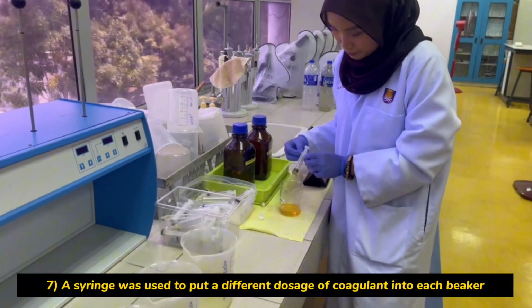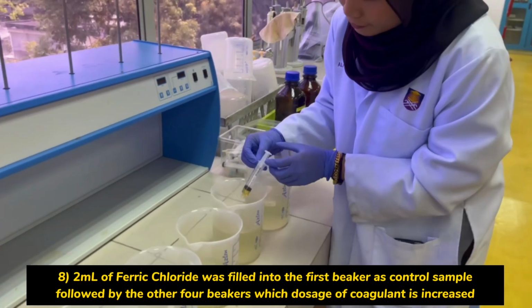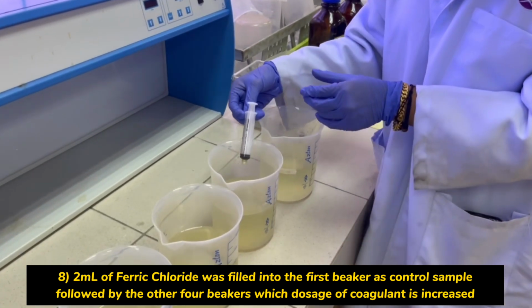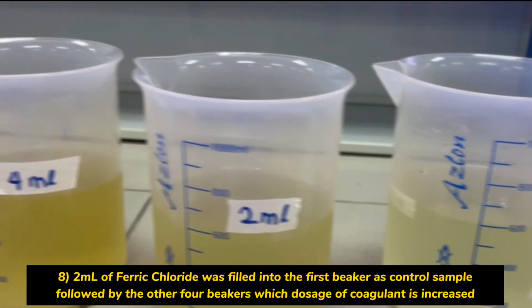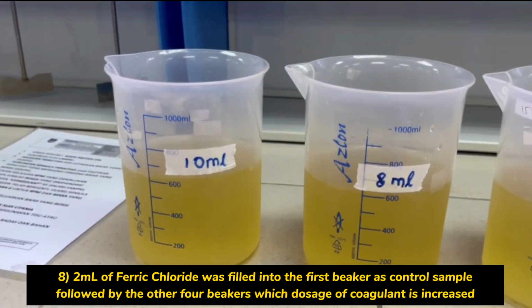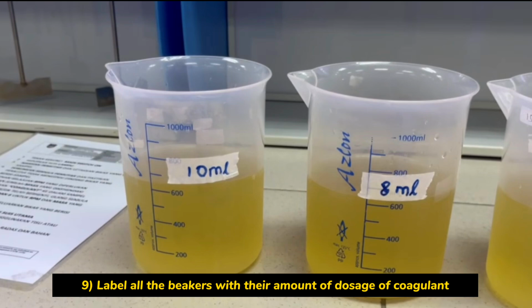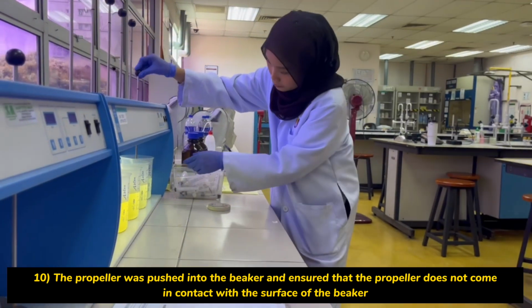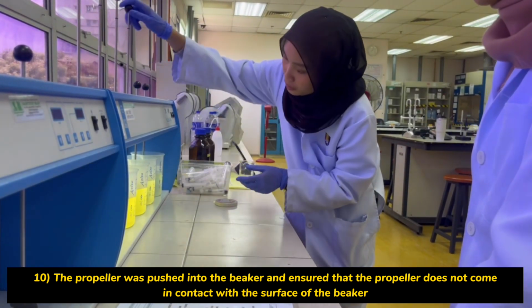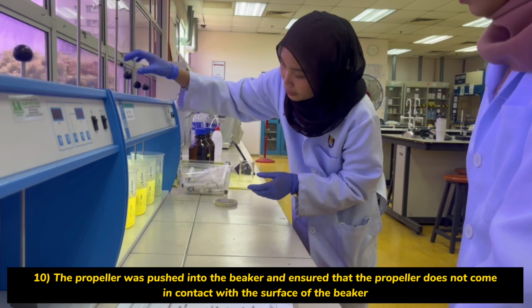Next, each beaker was filled with a different dosage of coagulant using a syringe. 2 ml of ferric chloride was added to the first beaker for the control sample, and then coagulant was added to the next 4 beakers. Label each beaker with the amount of dosage of coagulant, and then the propeller was pushed into the beaker and ensure that the propeller does not come in contact with the surface of the beaker.